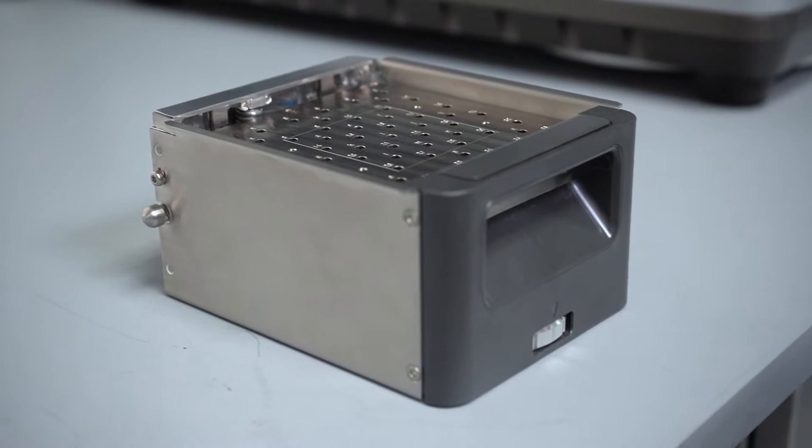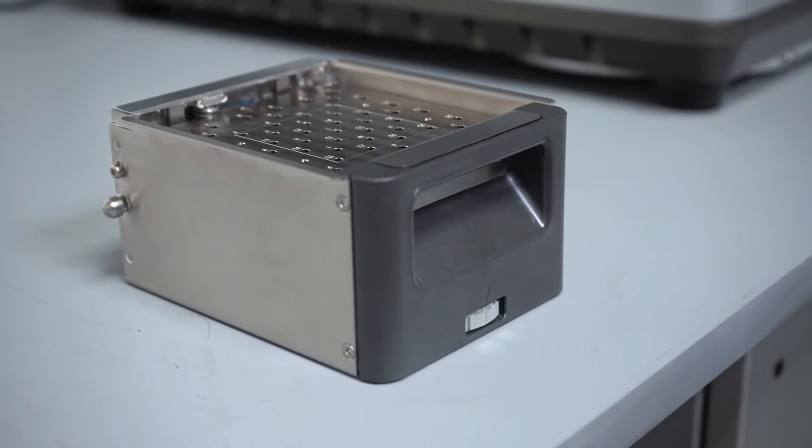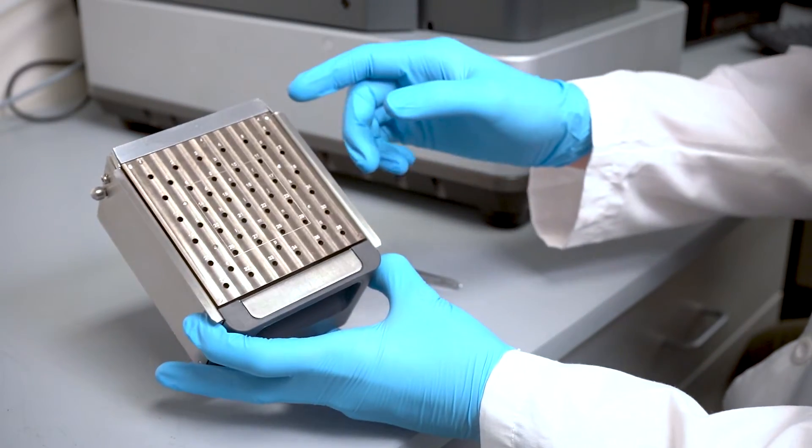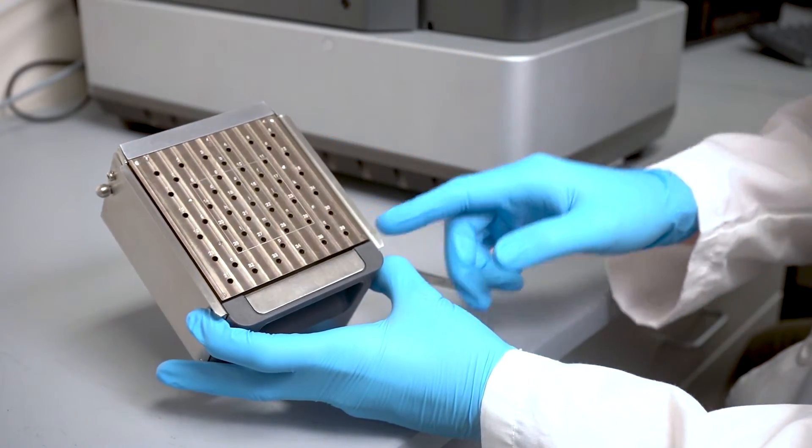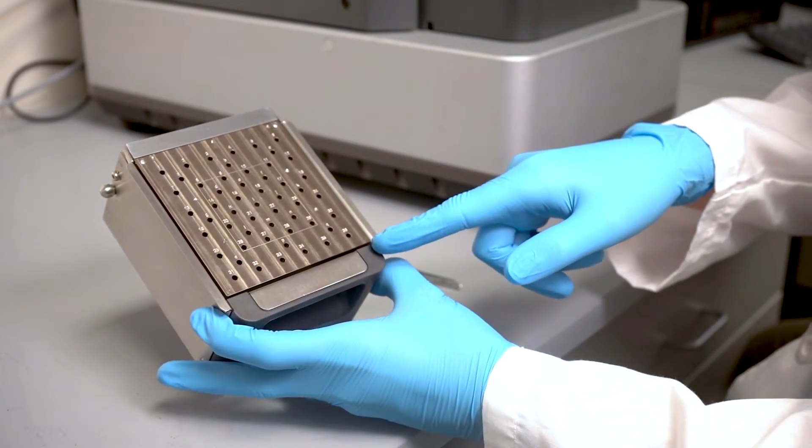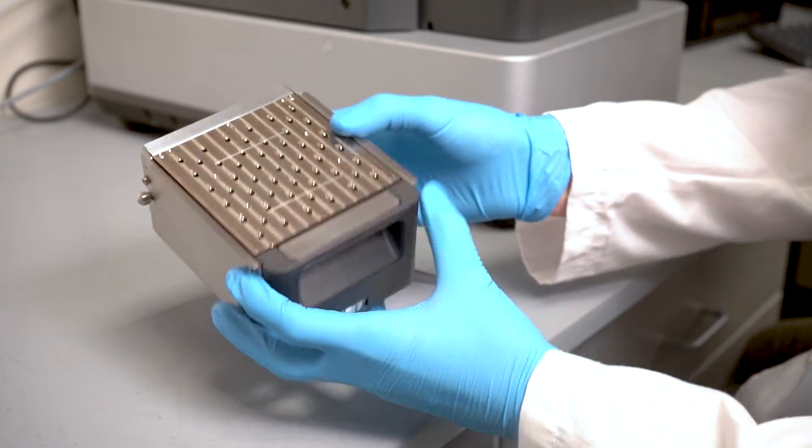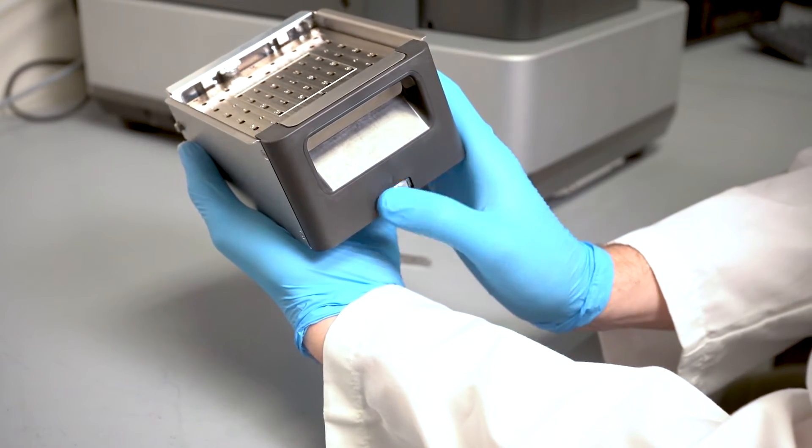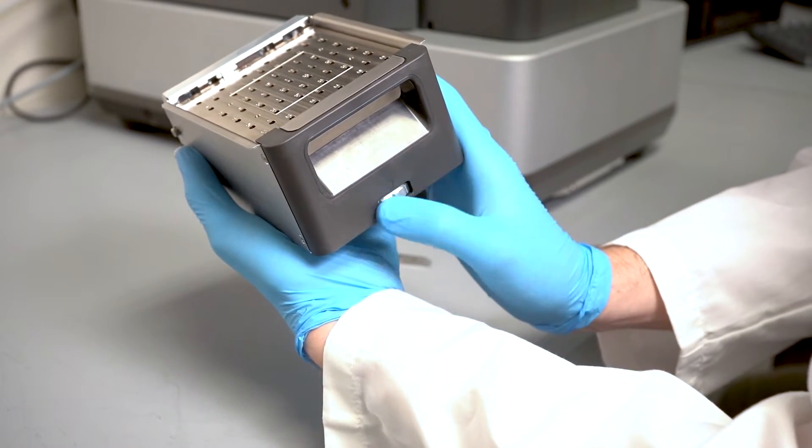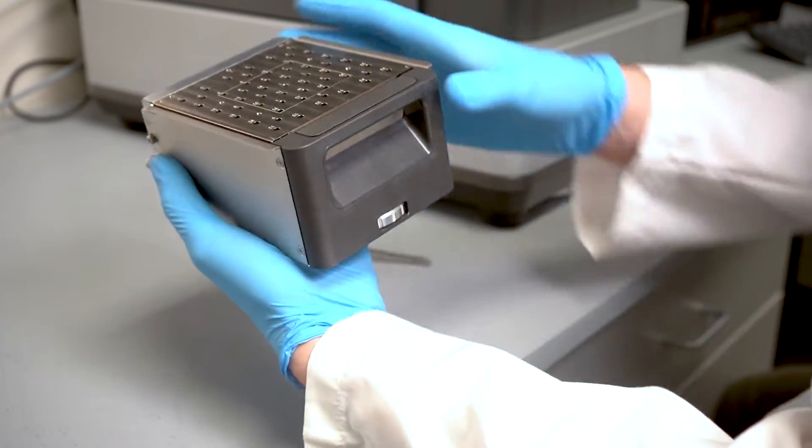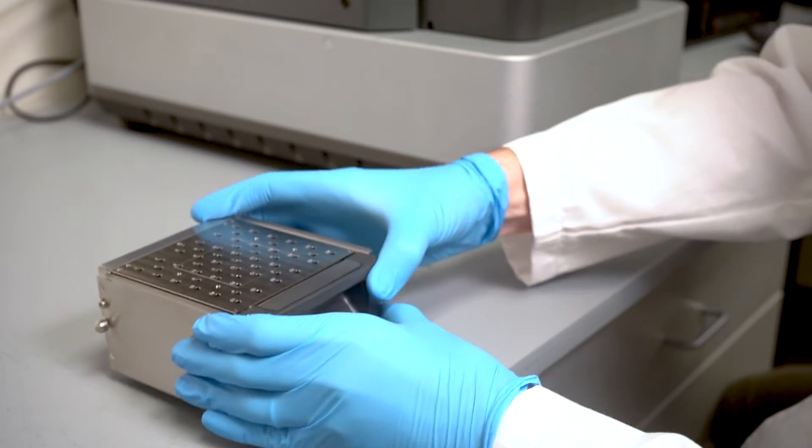Featured here I have the stage of the Phenom XL. It can hold up to 36 sample stubs with a 100 by 100 millimeter area and go 40 millimeters in depth. This will allow us to accommodate many different sample types.